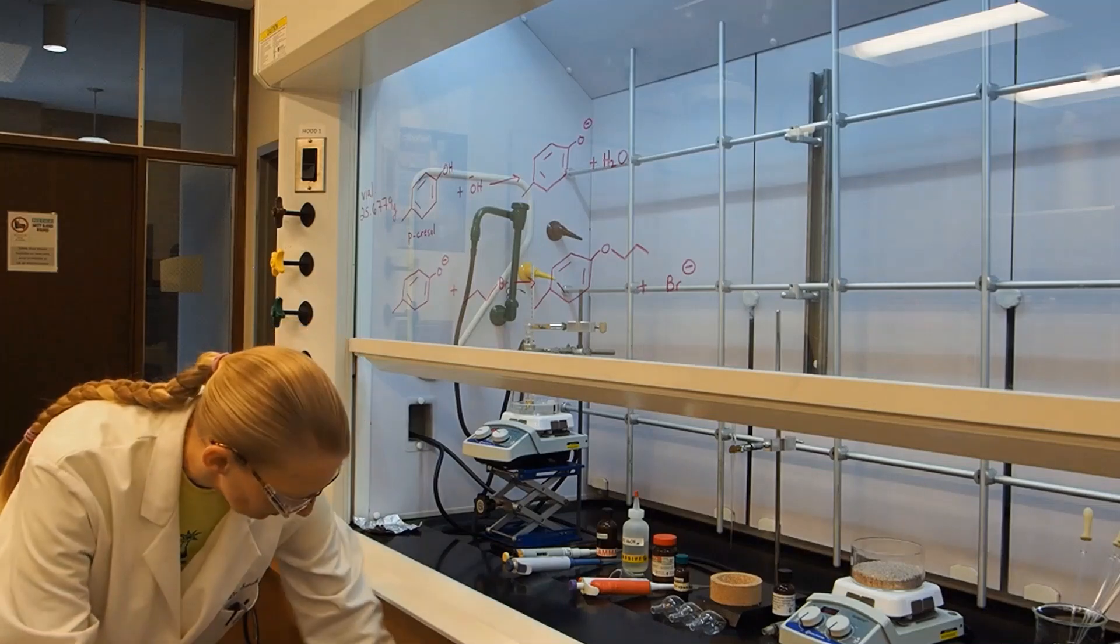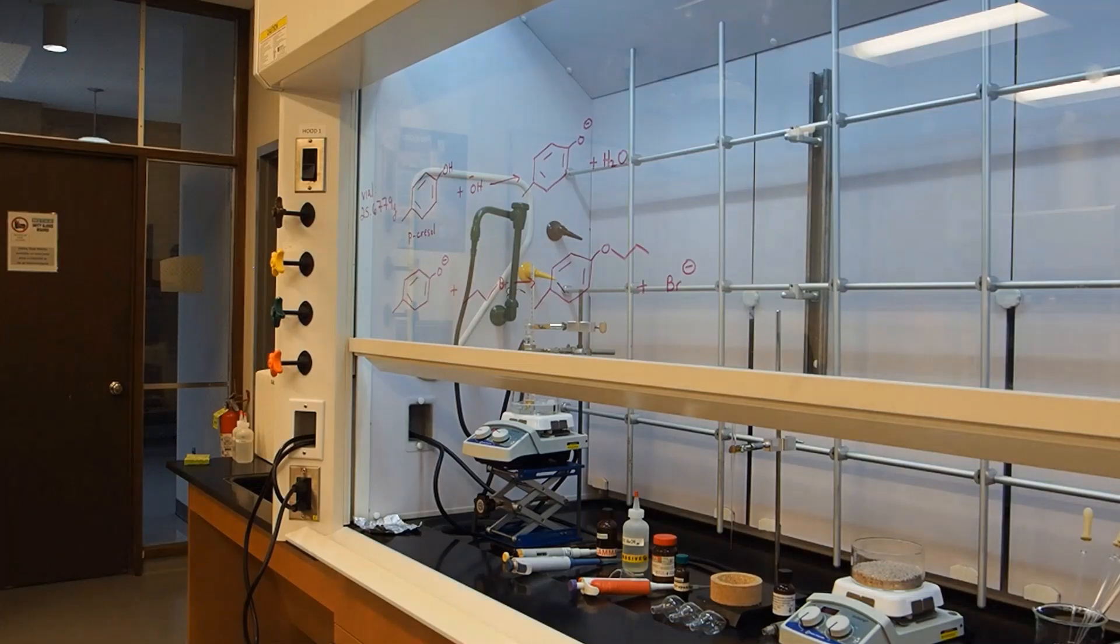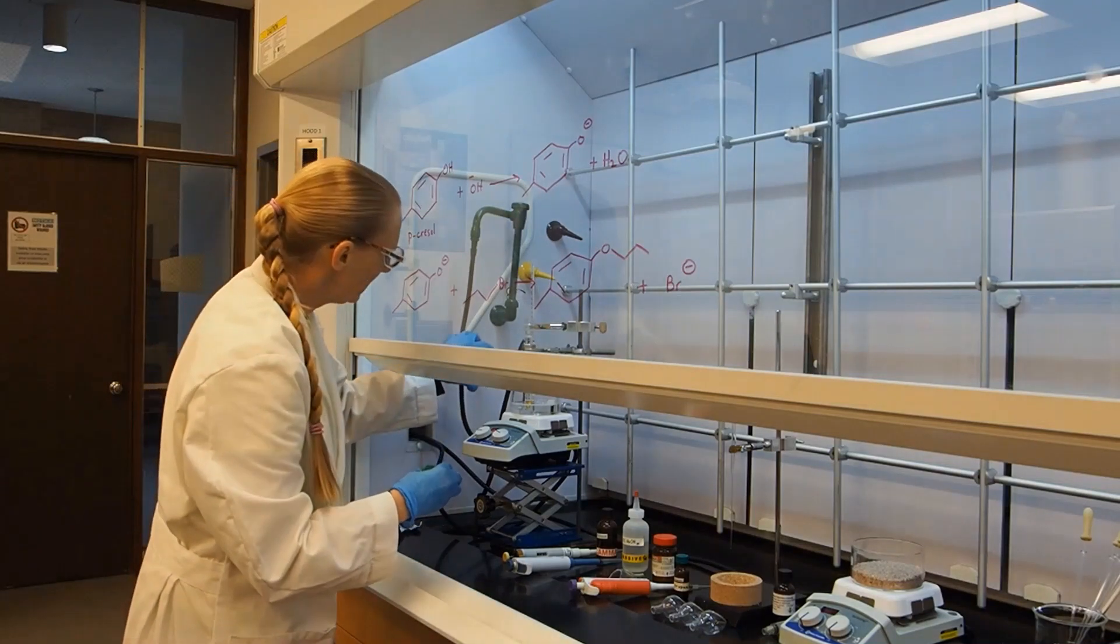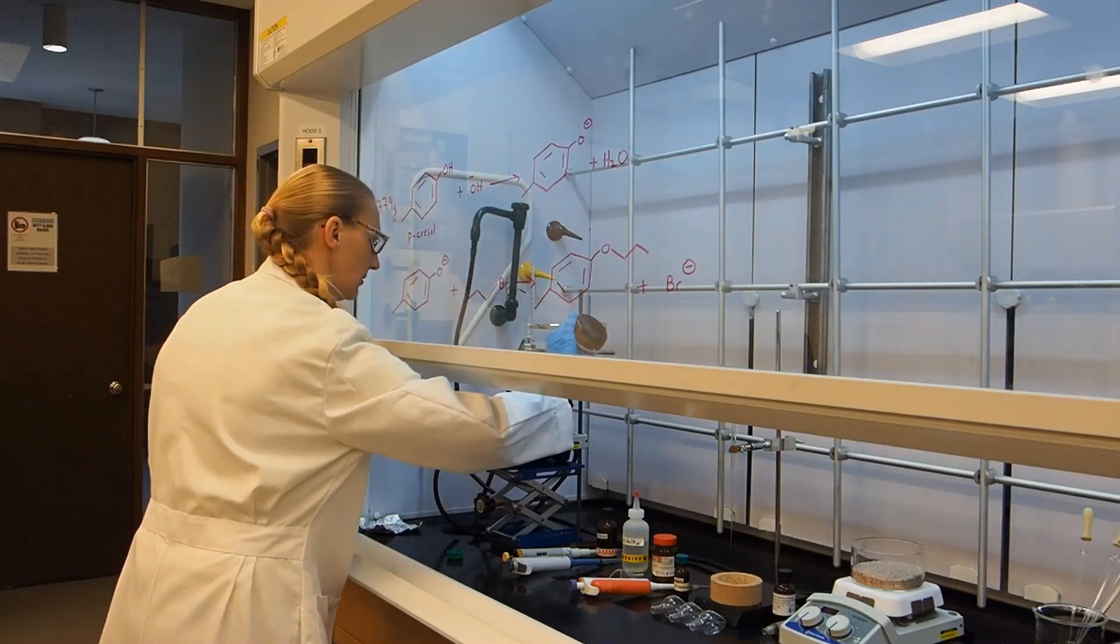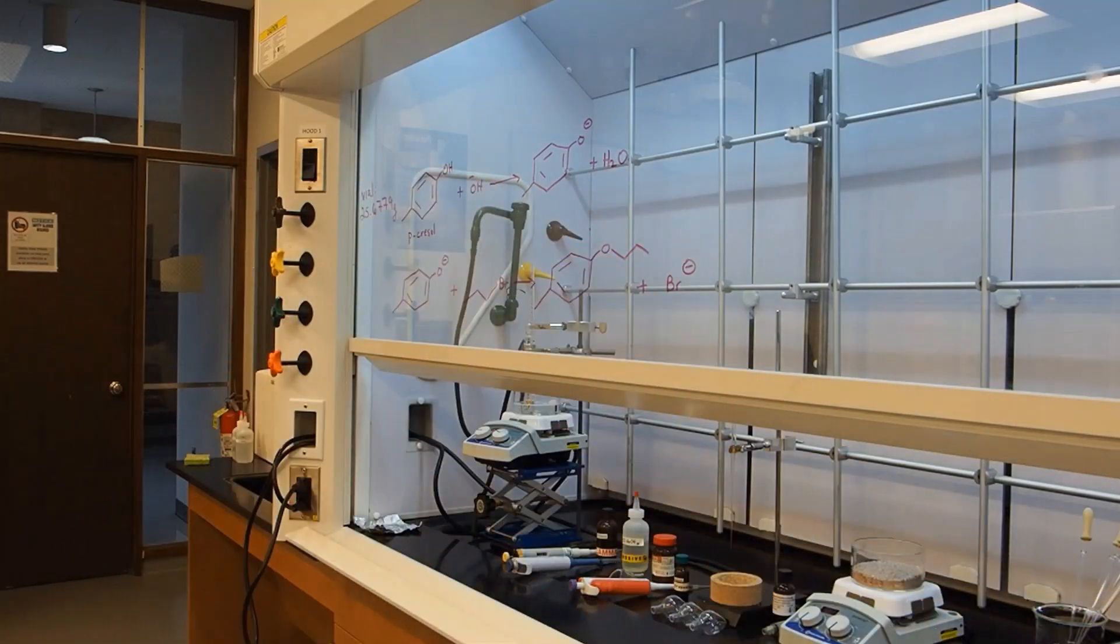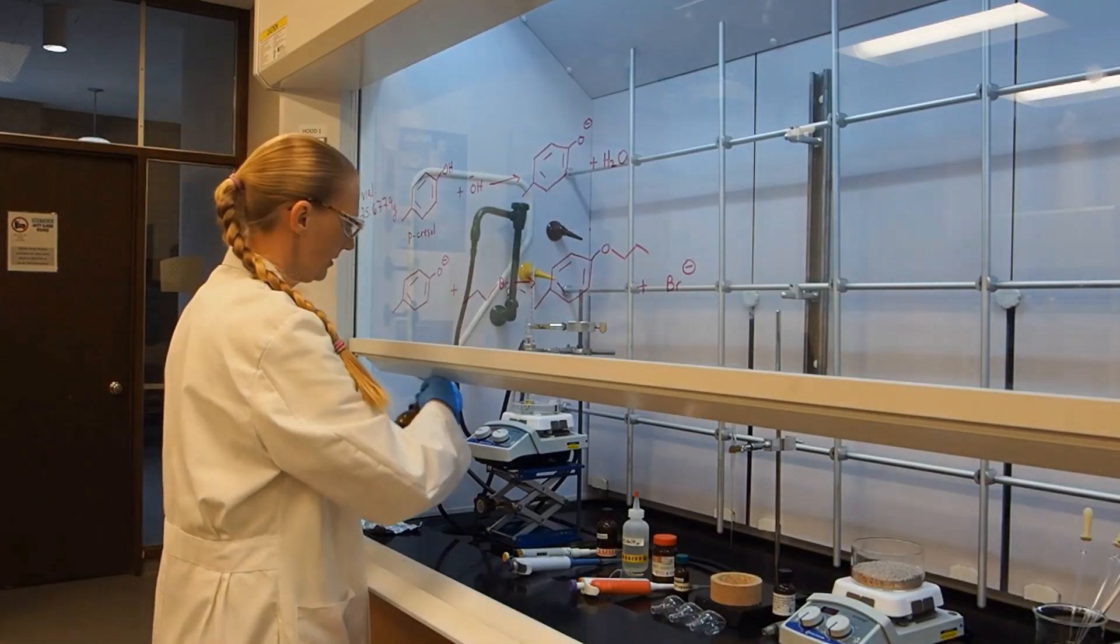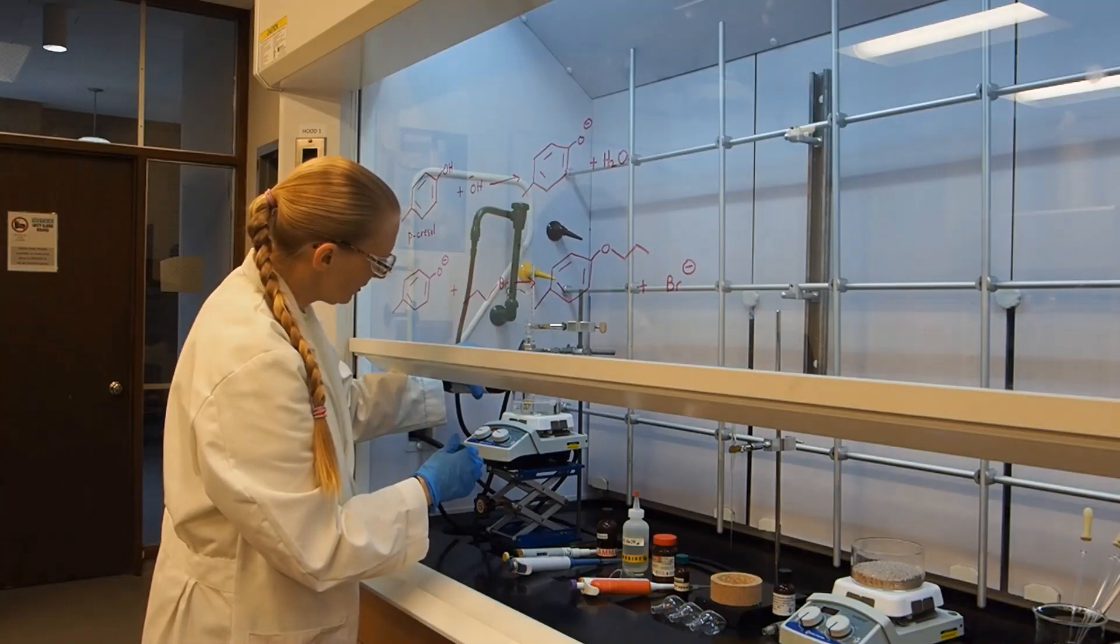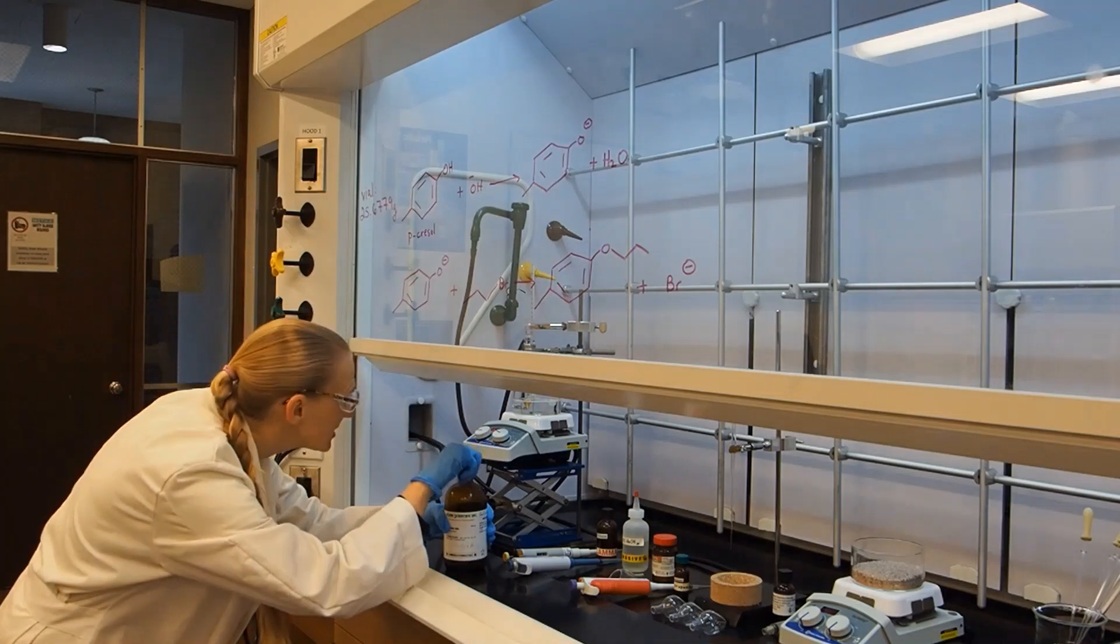I think I'm going to add a little bit of oil to my oil bath here. There's not very much in there, so maybe a different bottle.